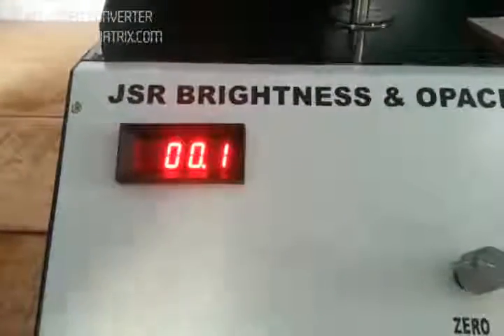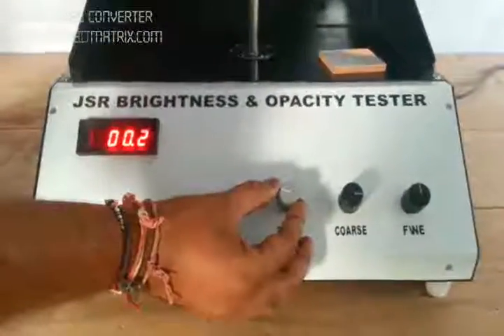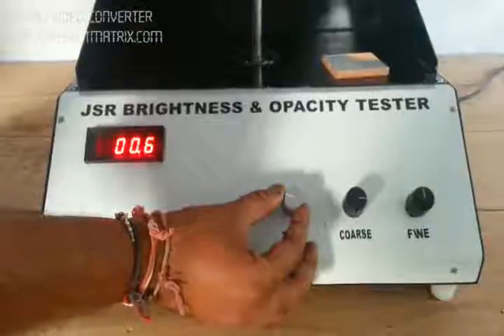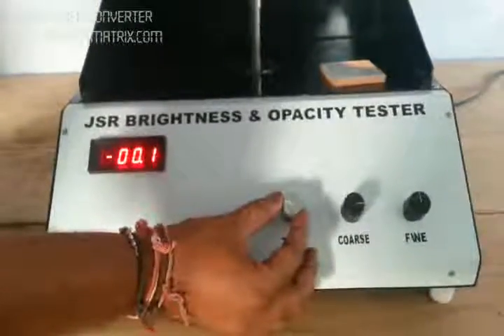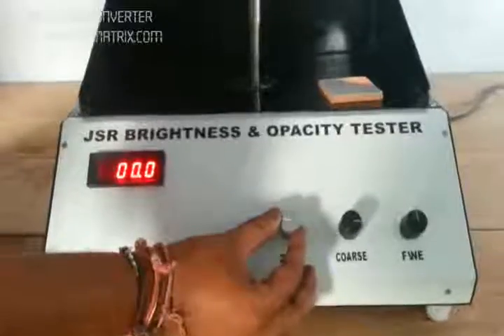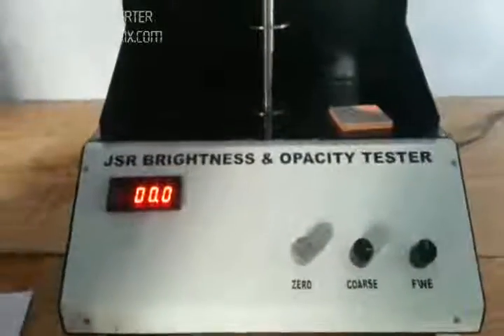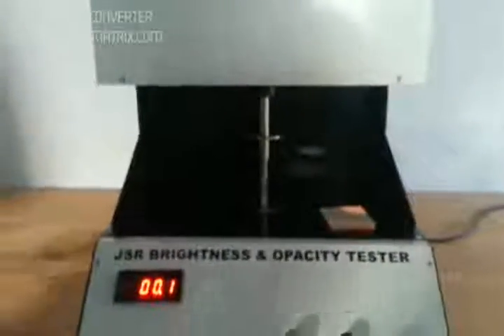The brightness reading is zero. We make it zero by using the zero knob. Now the reading is zero.